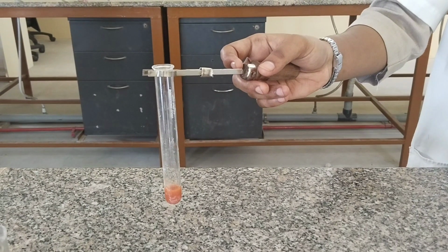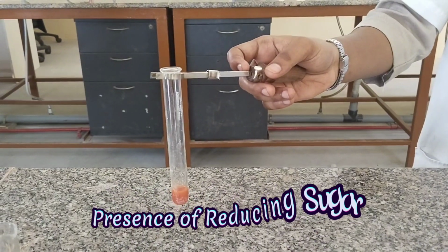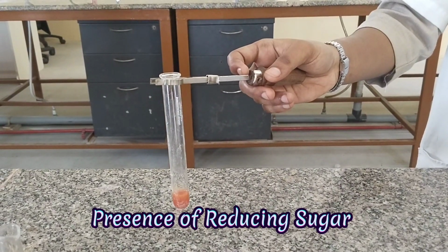Observation: orange color is obtained. Inference: presence of reducing sugar.